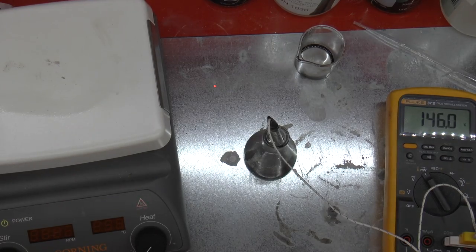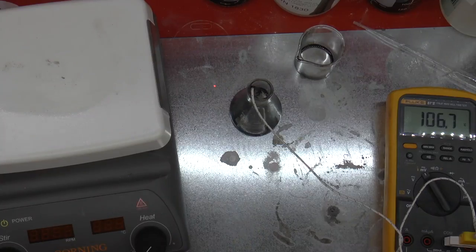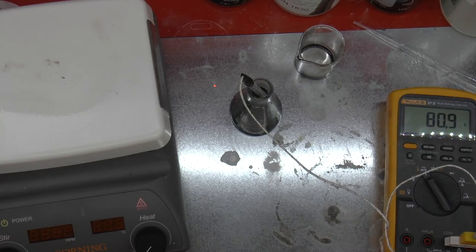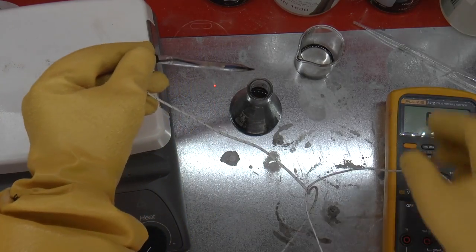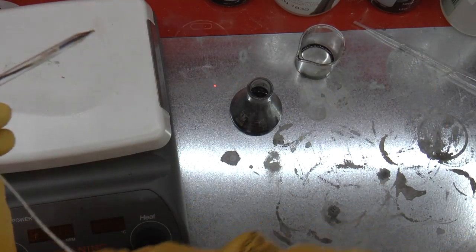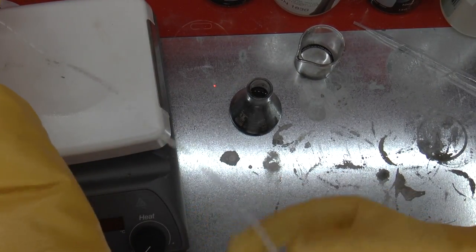This part takes about 10 minutes or so, a little less. Hooray for time scaling. We're done. It's about 65 Celsius or so. That's good enough.